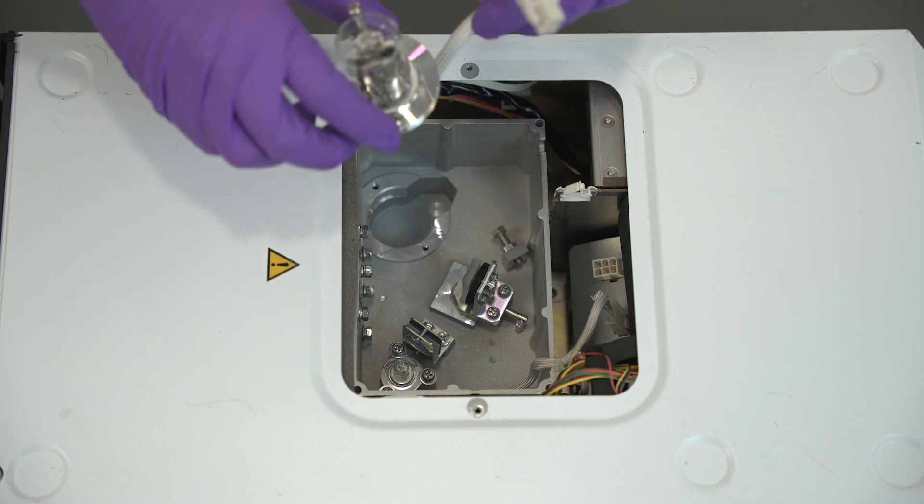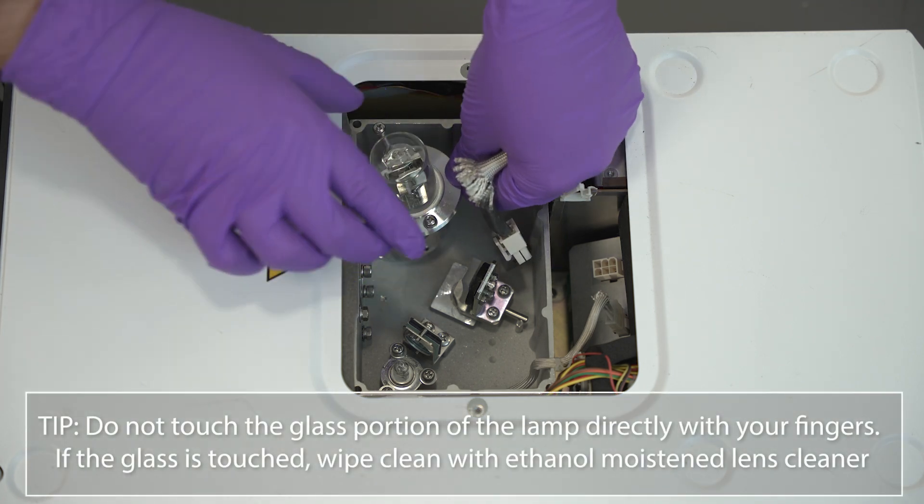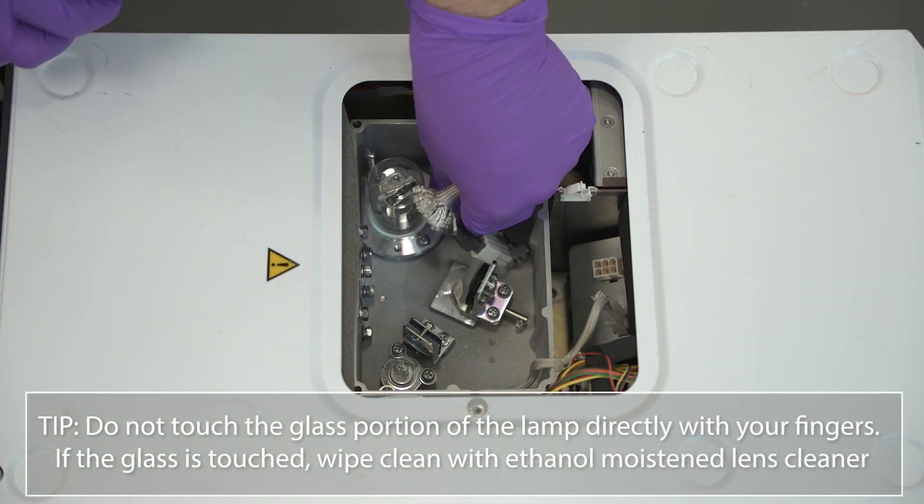Unpackage the new deuterium lamp. Do not touch the glass portion of the lamp directly with your fingers. If the glass is touched, wipe clean with ethanol moistened lens cleaner.